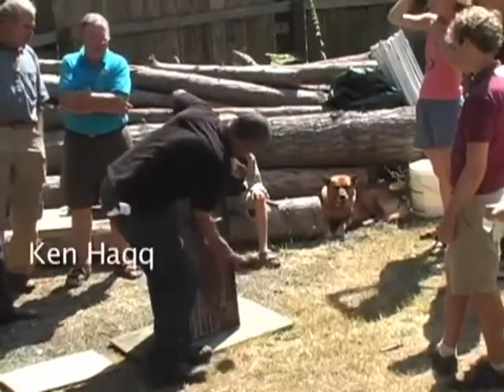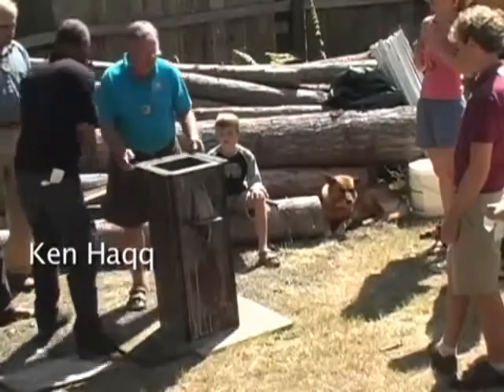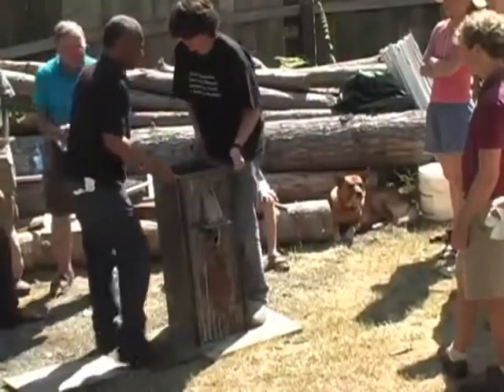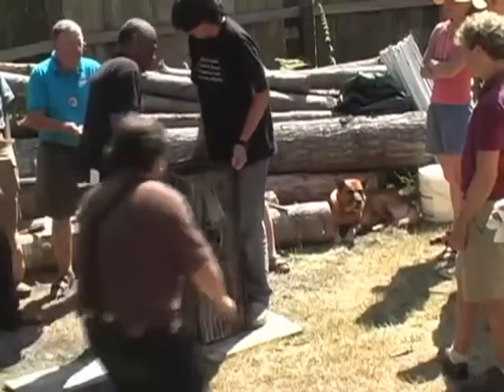Same. We need more paper towels? Oh, we got some? That's all right. So you can, all right, next step. No, Dell, you shouldn't do this. Somebody else should. Yeah, it gets me dirty. Good. Easy does it. If it doesn't come easy, make sure it's easy.